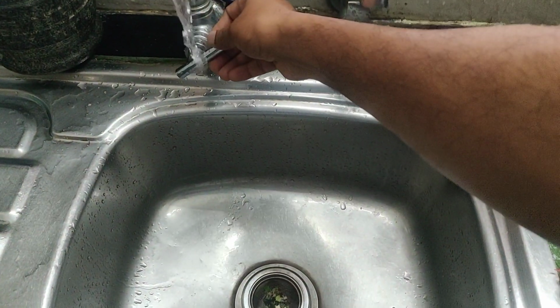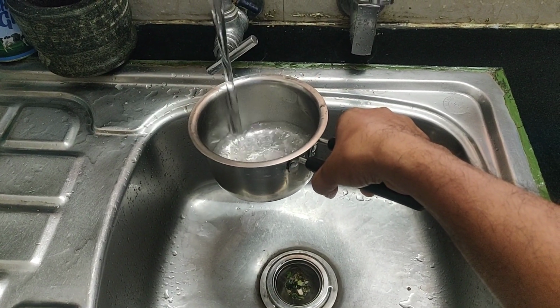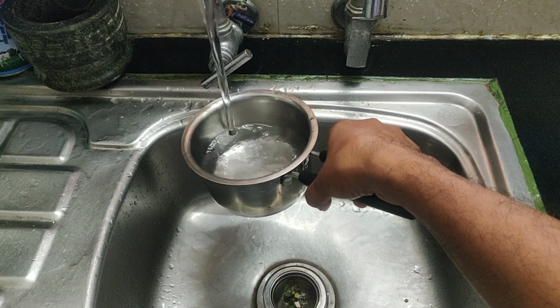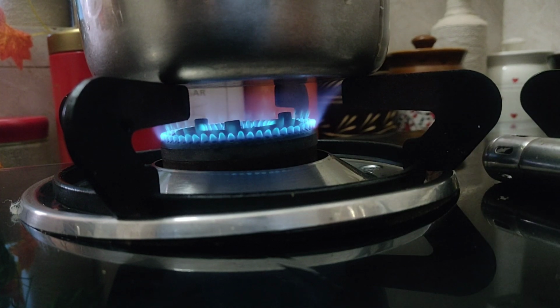Right now, I am collecting normal tap water. Tap water can already contain microorganisms, spores, or other organic particles. So before starting this experiment, I want to reset everything as much as possible. This is important because if we don't control day 1, we won't know what changes are caused by the things we add later.